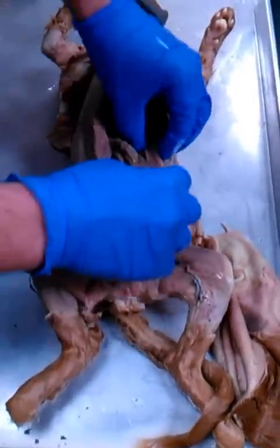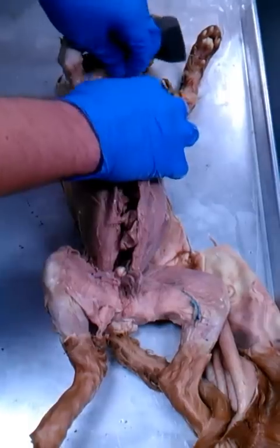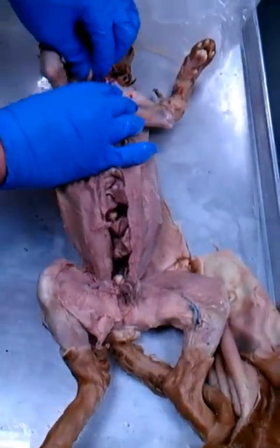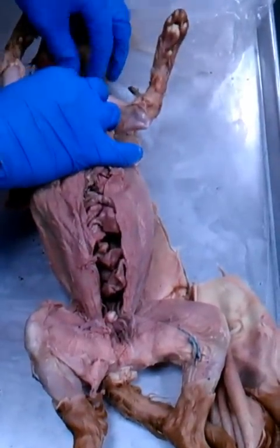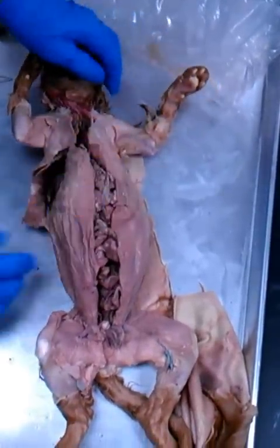So let's remember this used to look kind of like this eventually. Again, we'll start with superficial muscles, which means everything has to be flapped shut. If you look at the top here, you have to imagine that these things were still touching. Let's look at just this side over here.